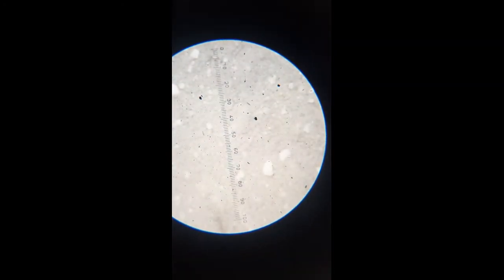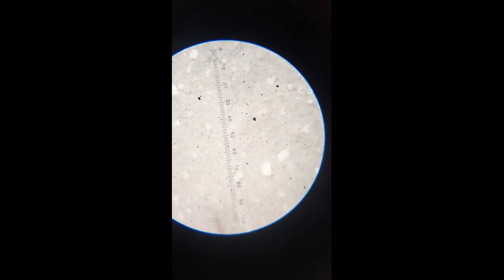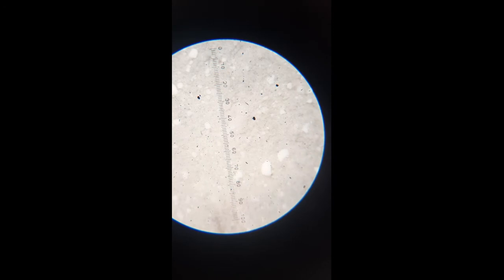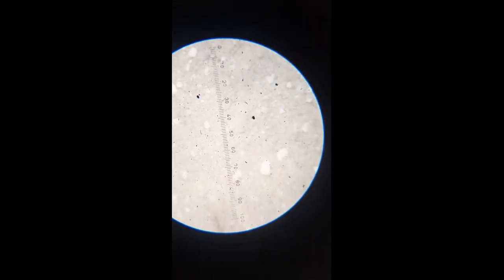So this is the way in which you see the particles through the microscope. Okay, if you see the scale, using that scale you have to measure almost 300 to 500 particles and determine their particle size. So using this eyepiece we are going to measure the particle size for almost 300 to 500 particles. Once the particle size is determined, we will move forward to the calculations. Okay, once the particles are calculated, we will see the observation table and how you write the result and conclusion.